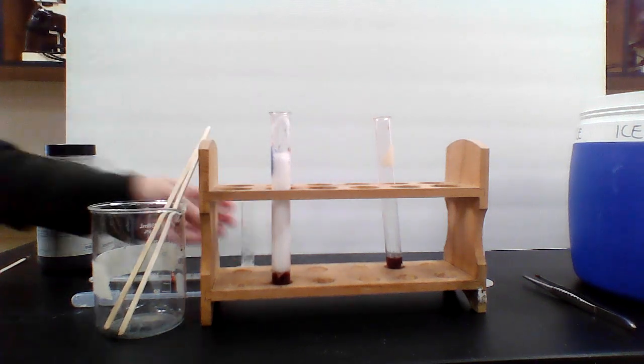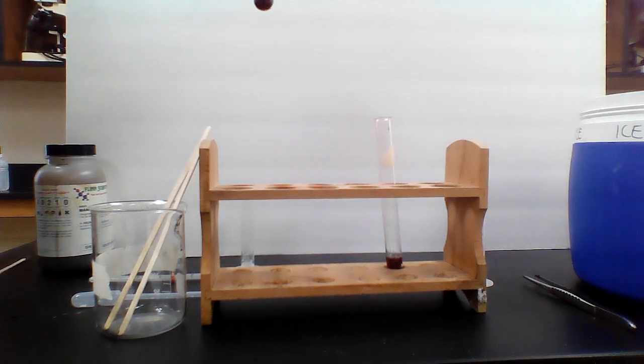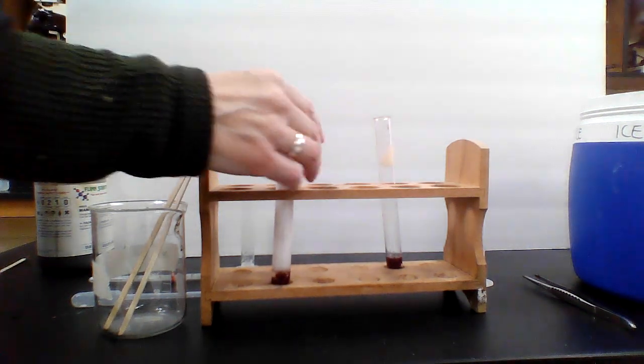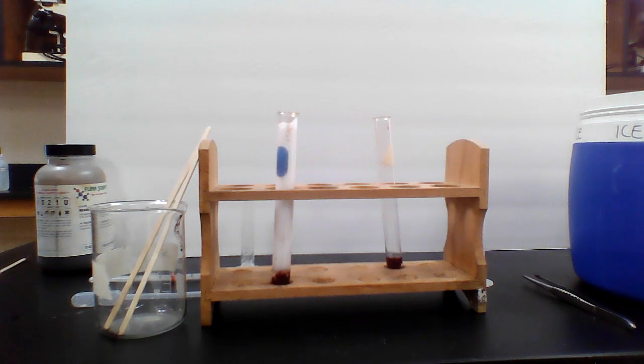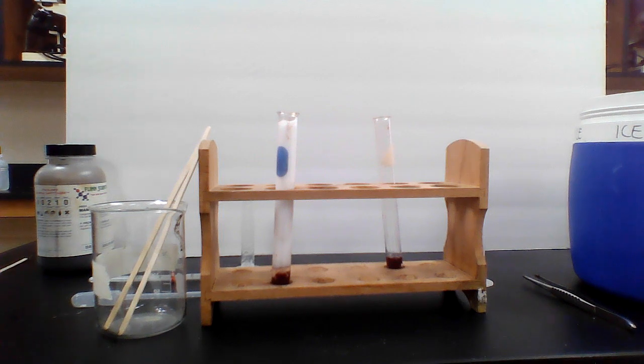Ooh, that's unexpected. That's a lot of bubbling, ladies and gentlemen. Not as high as the ones we saw initially. So I would give this one a 9 for bubbling. So it's doing pretty well, but not as well as the ones that went over the top. So this is sodium hydroxide.